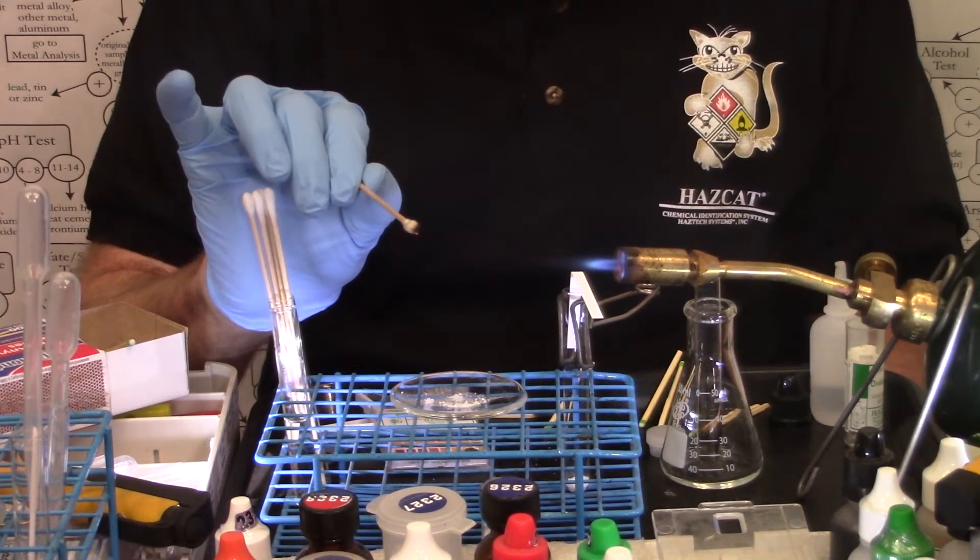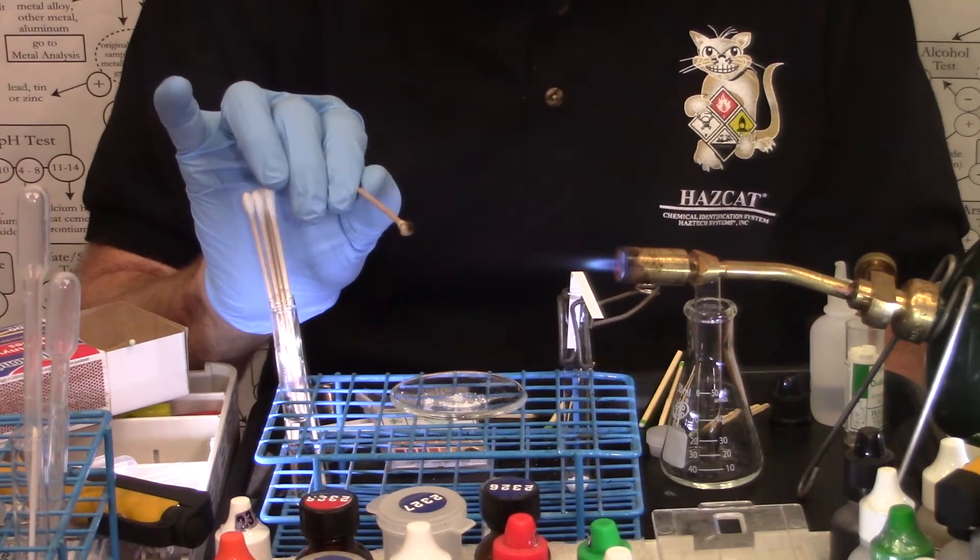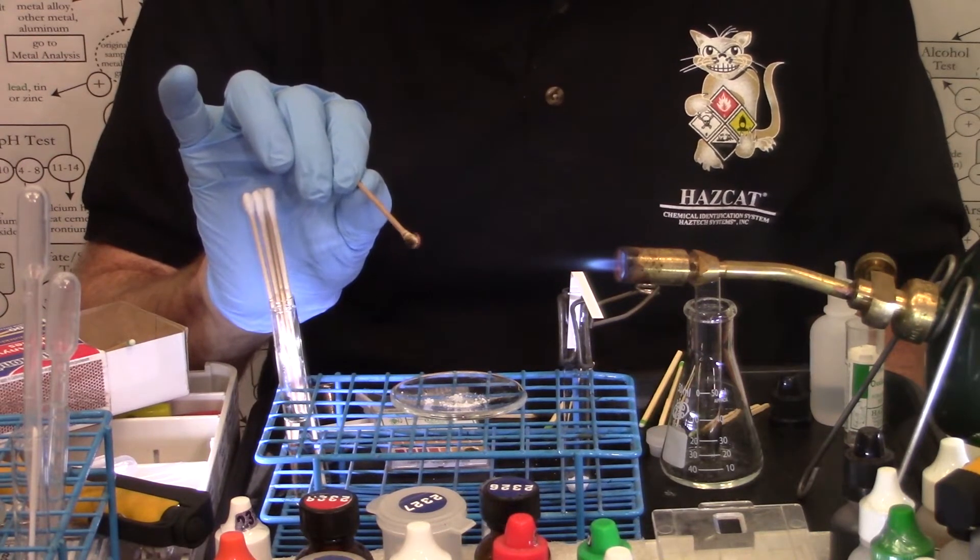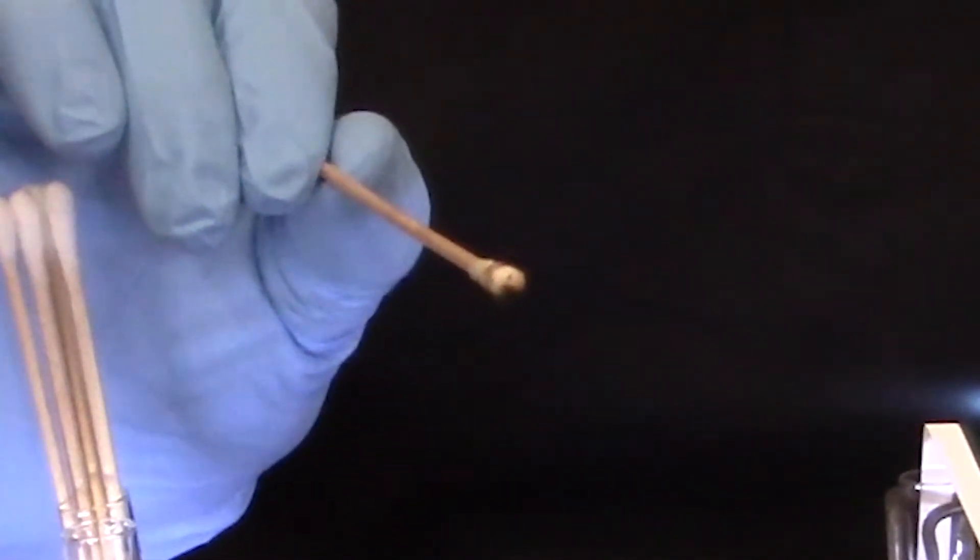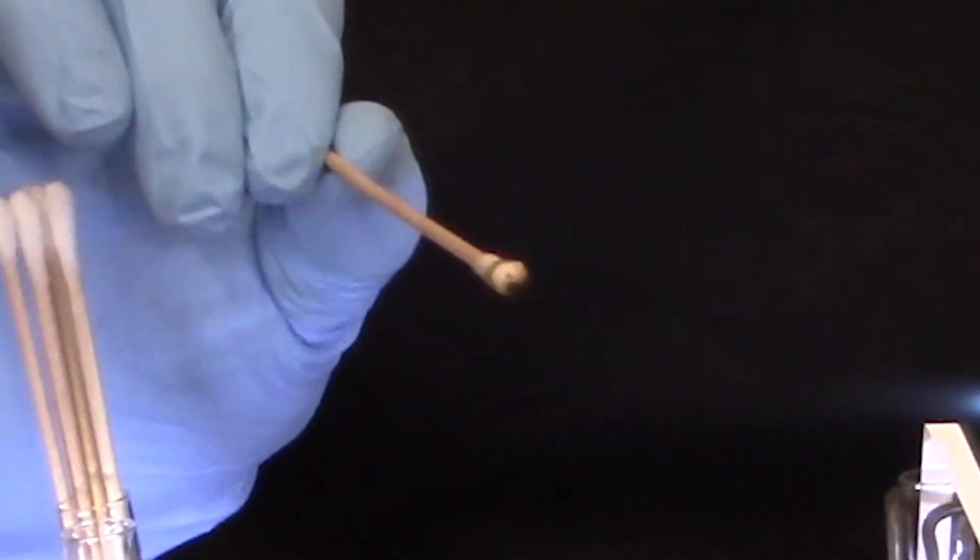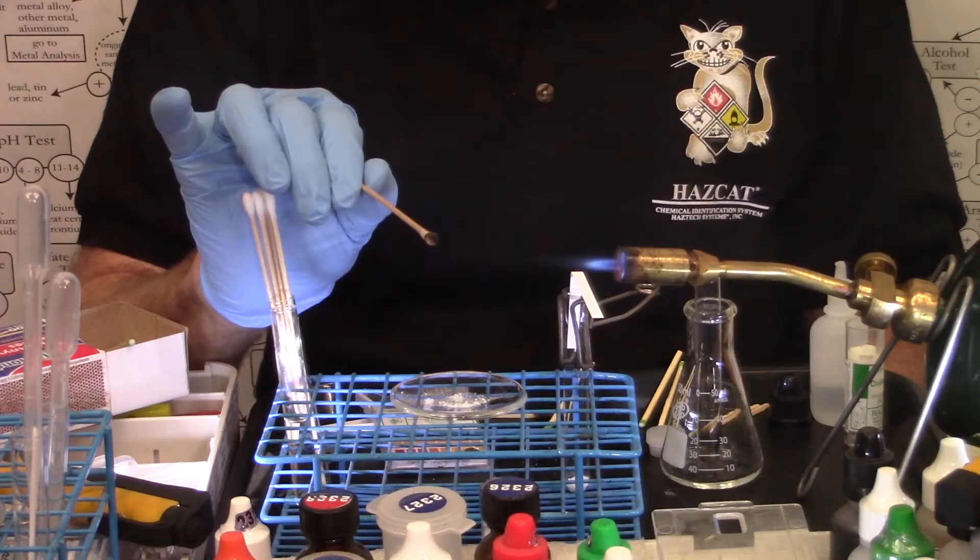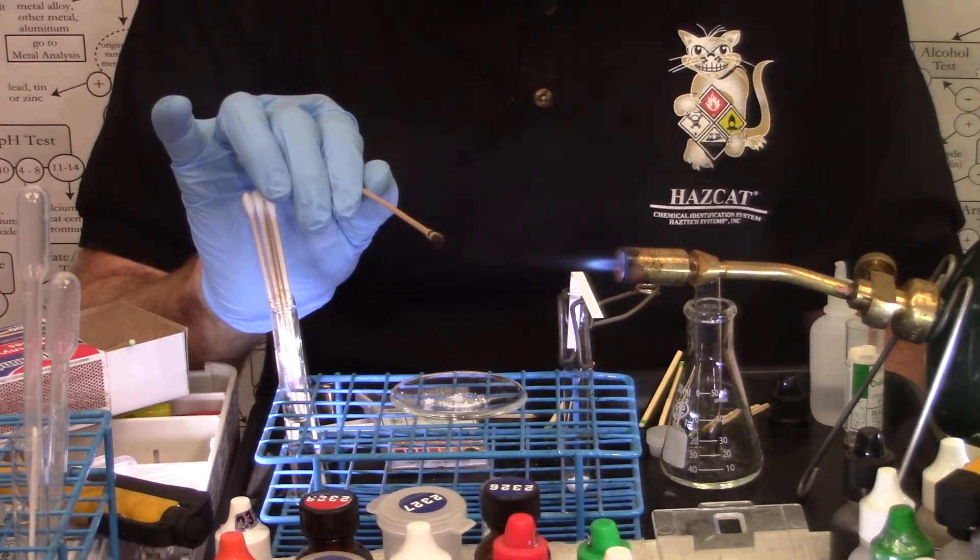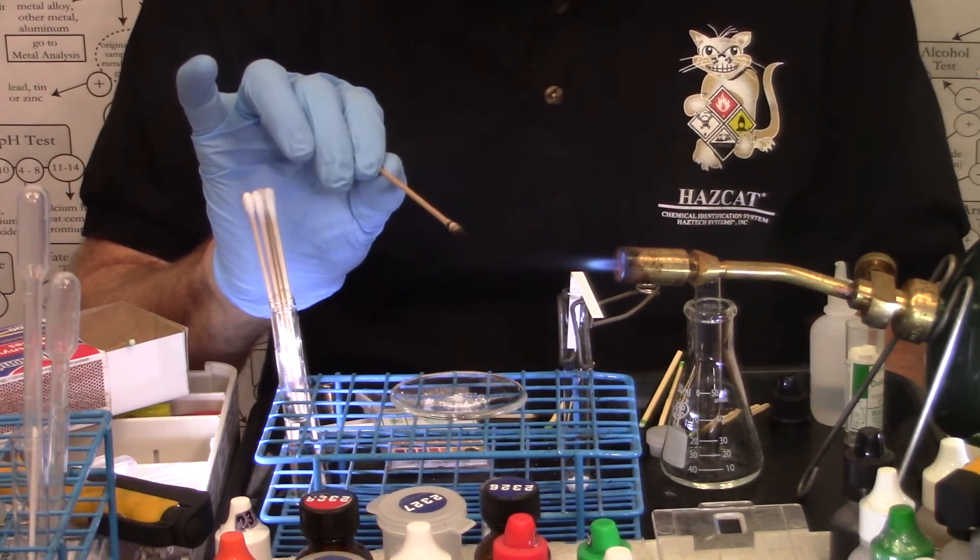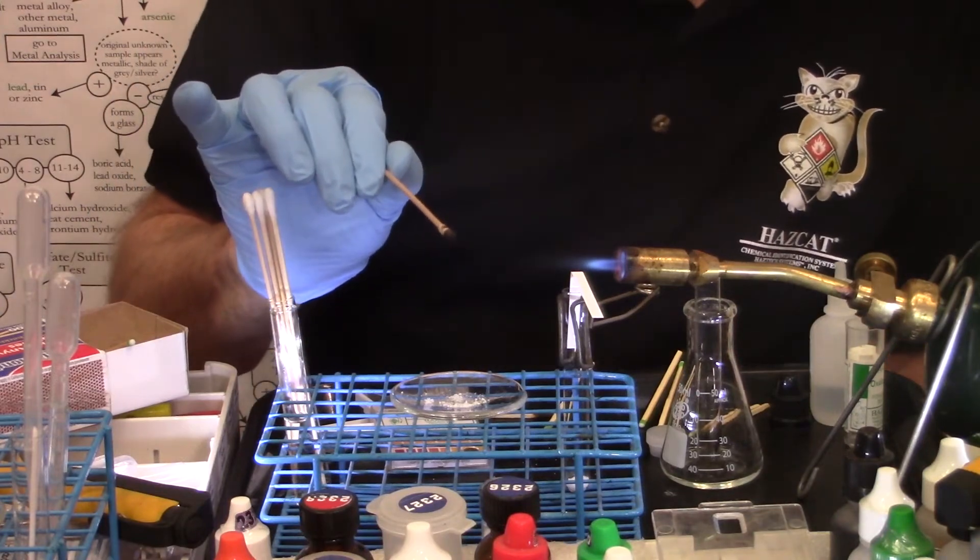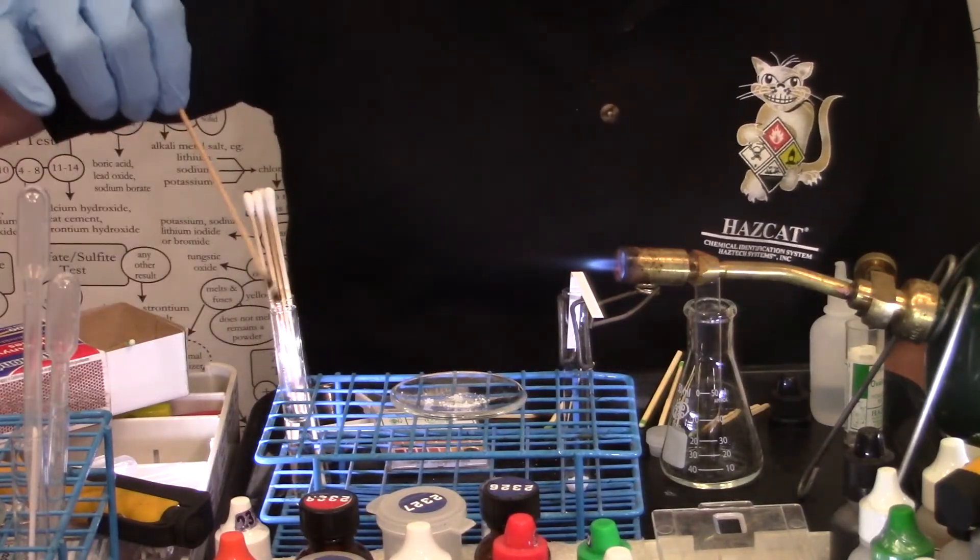A little bit of sparking going on. No audible snap, crackles or pops. I'm going to keep going until at least the swab is, the cotton is burning, and just starting to see that now. Nothing too energetic, I'll go ahead and douse that.